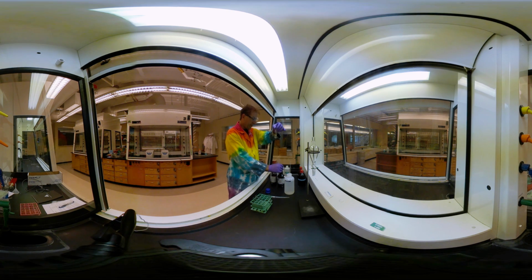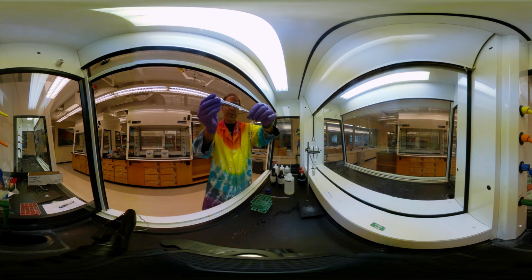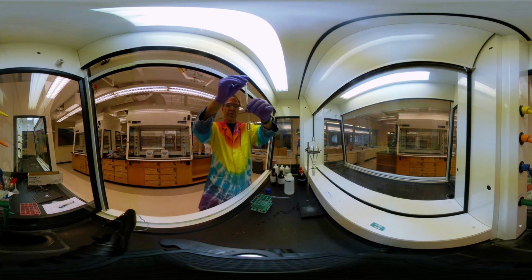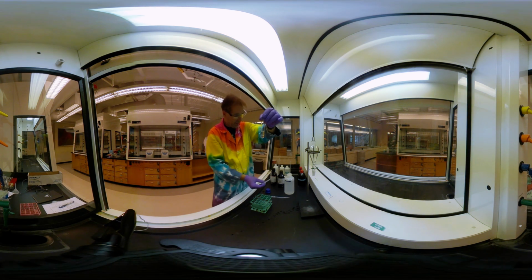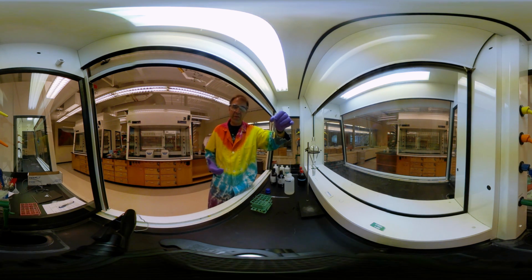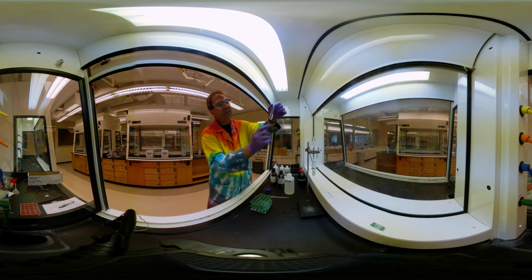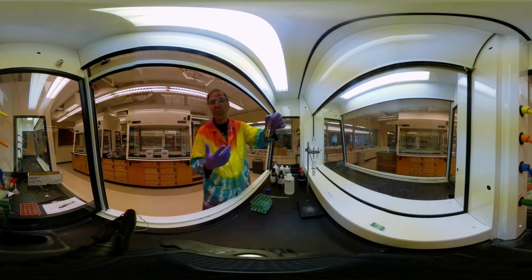Now, as I poured it in, you probably noticed something. Whoa, got some evaporation happening there. As I drop this in here, notice that the material I'm adding is sinking to the bottom. I'm getting a little layer there, but then it goes down. Dichloromethane is also an organic solvent, but it's denser than water. So in this case, the organic layer is on the bottom. So you have to be very careful with that.